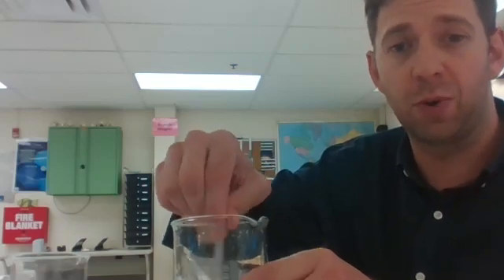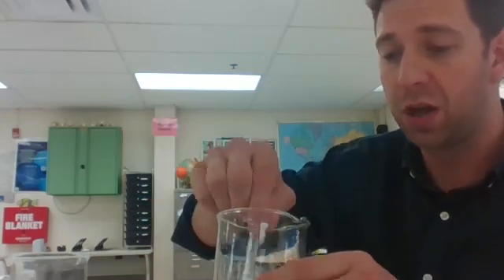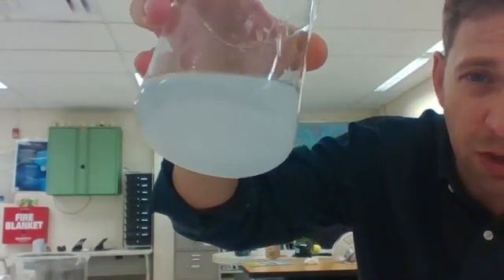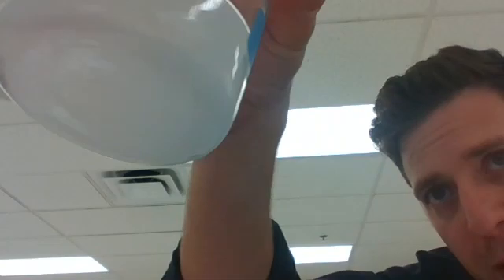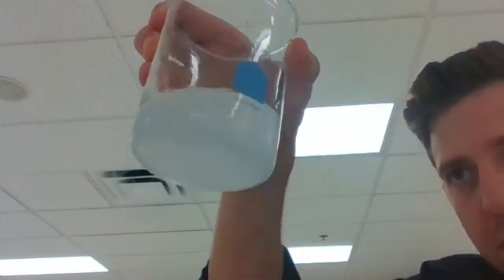If you imagine putting sand in water, you can stir forever and the sand's not gonna dissolve. It's gonna be a mixture, not a solution. So anyways, we see the fogginess, maybe a little bit of dissolving right there, but if you look at the bottom, you can see all that salt just sitting there. Actually, let me stir one more time. It might take a minute to settle, but I'll wait.